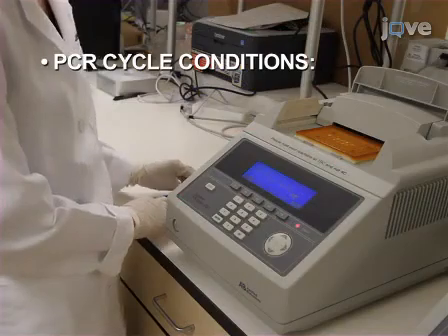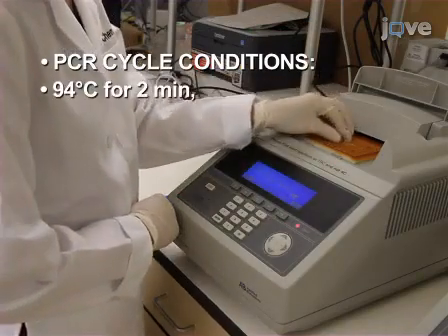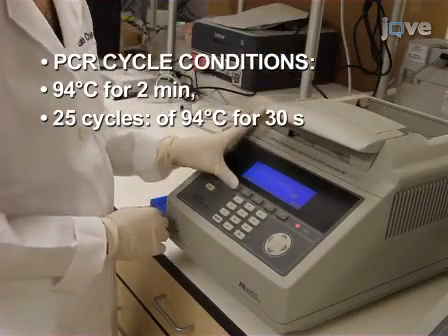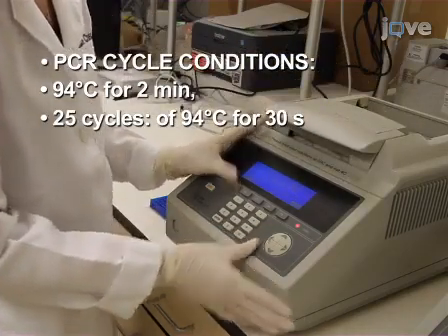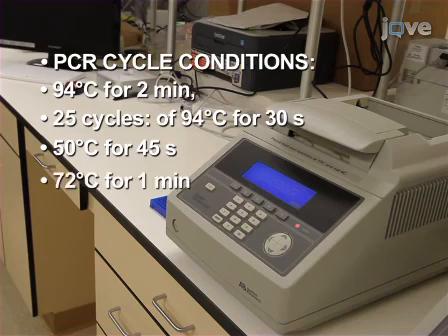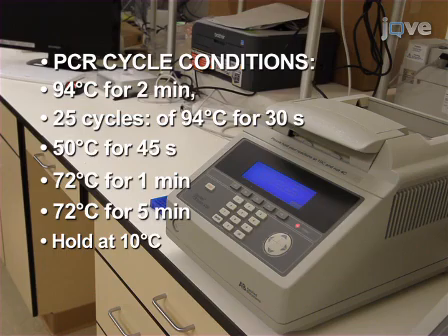Then, run the PCR protocol as follows: 94 degrees Celsius for 2 minutes, followed by 25 cycles of 94 degrees Celsius for 30 seconds, 50 degrees Celsius for 45 seconds, and 72 degrees Celsius for 1 minute. Then, a final extension step of 72 degrees Celsius for 5 minutes, followed by a hold at 10 degrees Celsius.